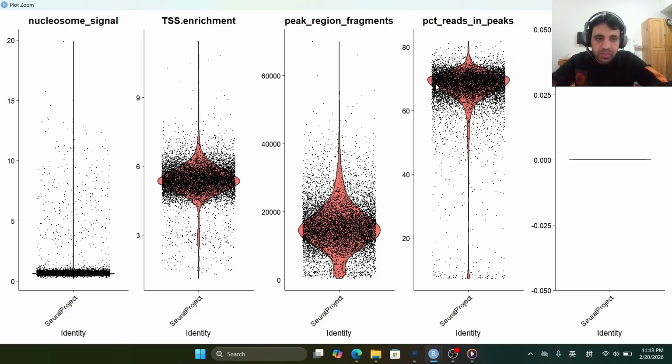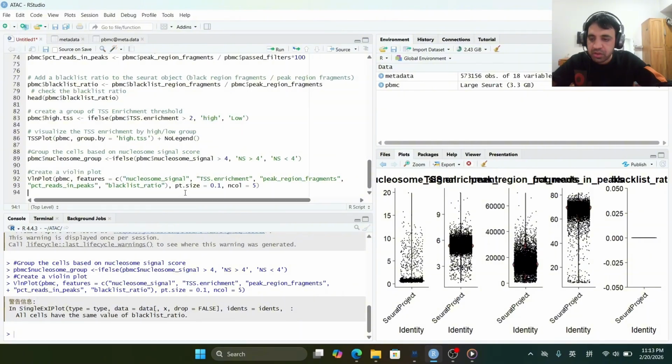And similarly, the PCT reads in peaks violin plot shows that almost no cells are smaller than 20%, which is a good indication. And also there is minimal or no sign of blacklist contamination, and that is a good indicator. So we will now create a Seurat object. We will create a subset of the Seurat object based on these criteria, that will only have the high quality cells.